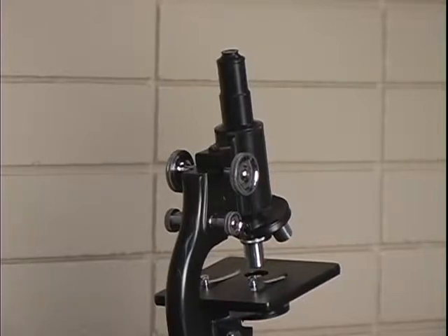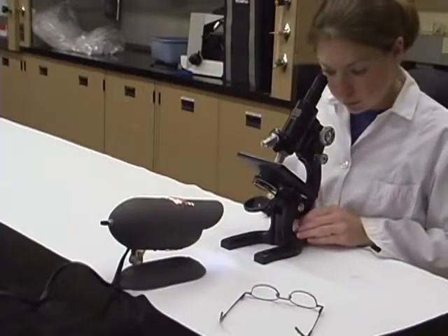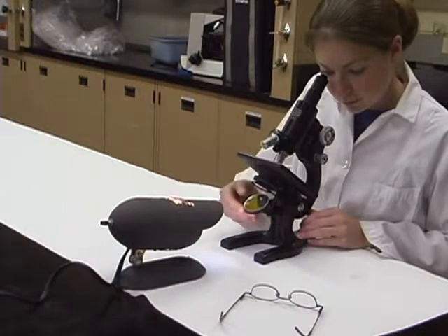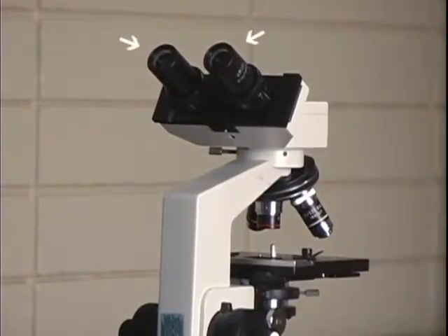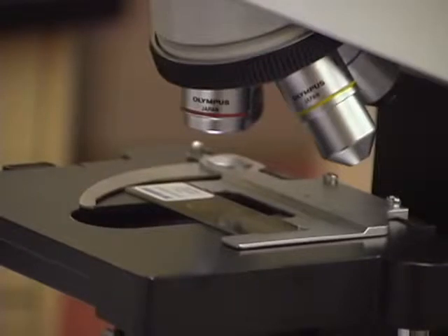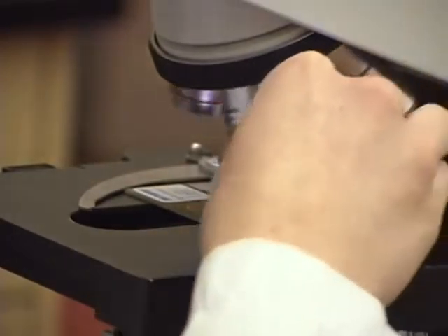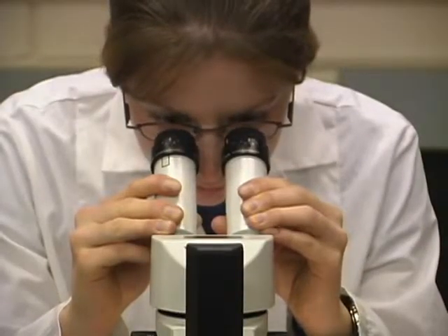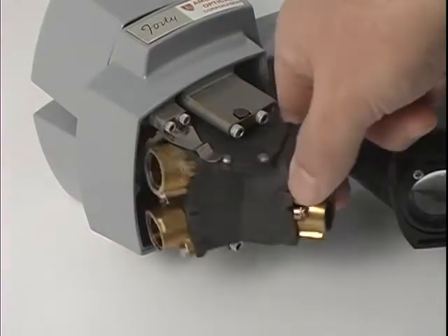Compound microscopes can be monocular or binocular. Monocular microscopes have only one ocular lens, and so only one eye can be used to view the object. Still, to prevent eye strain when using a monocular microscope, both eyes should be kept open. Binocular microscopes have 2 ocular lenses. However, binocular compound microscopes have only one objective lens that can be used at one time, and so the image is only 2-dimensional. Stereo microscopes are all binocular because they must have 2 ocular as well as 2 objective lenses to create 3-dimensional or stereoscopic images.